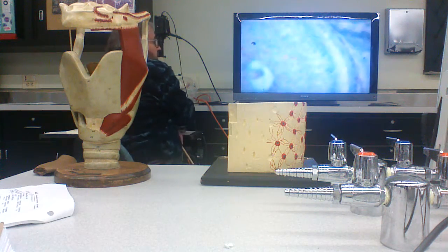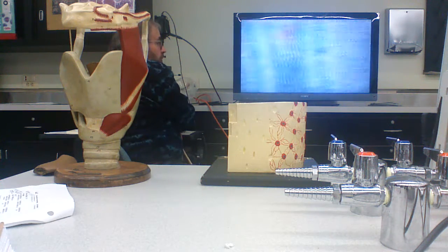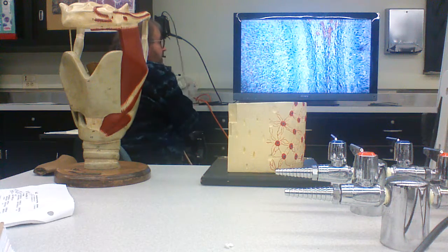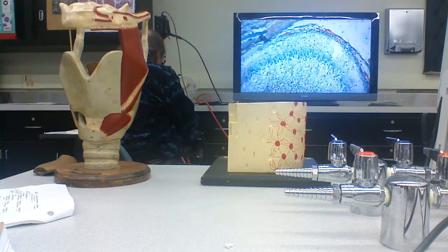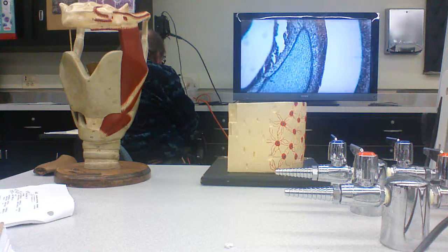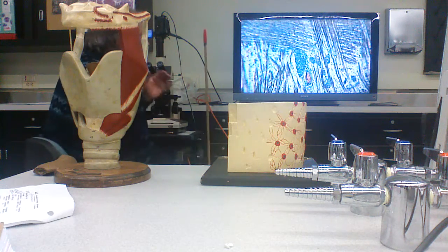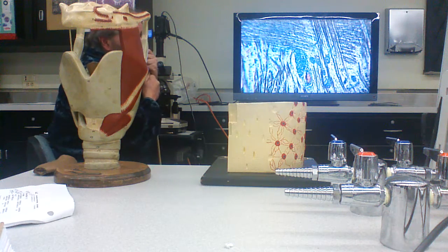These two things here are actually odontogenesis. These are rodents, and they're making those giant incisors that are going on here, amongst other things. So that's intramembranous bone formation, or ossification.